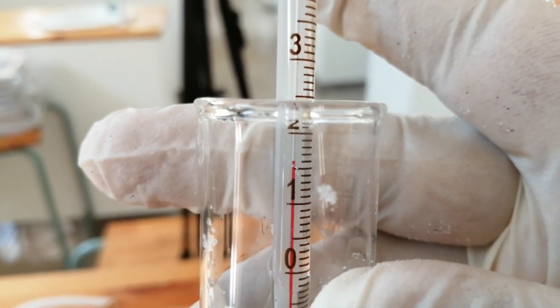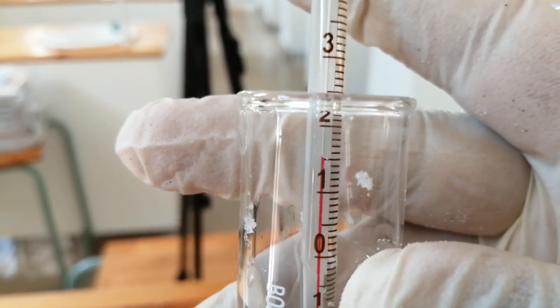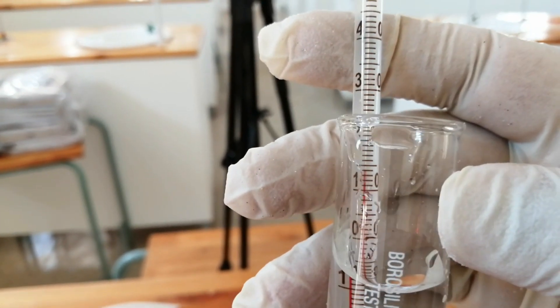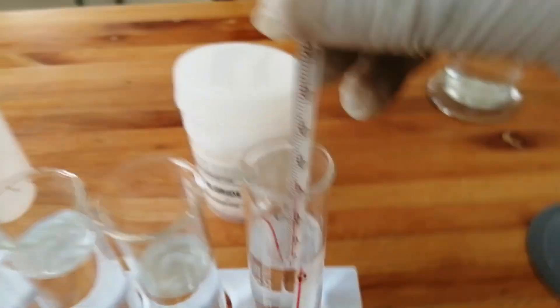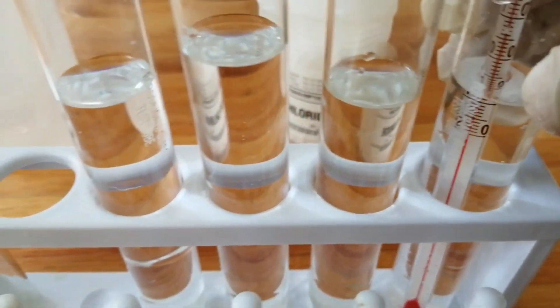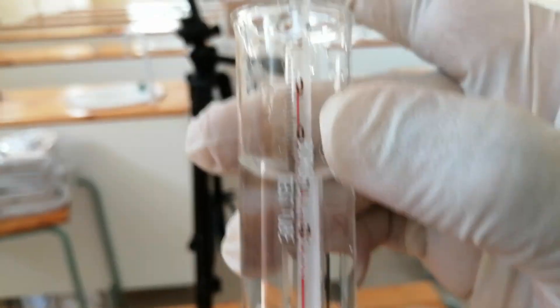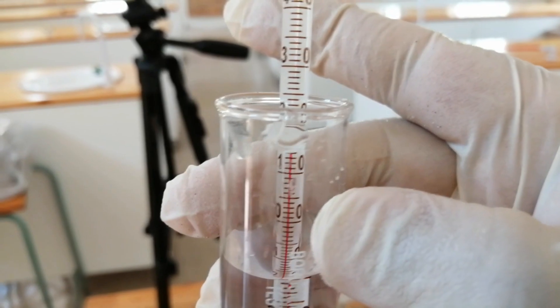Is the temperature increasing or decreasing? You can see that the temperature is going down — now it's 15 degrees. Let me shake the liquid. Let's check the temperature again — it's going down, going down. Now you can see the temperature is 14 degrees. It was 20 degrees before.